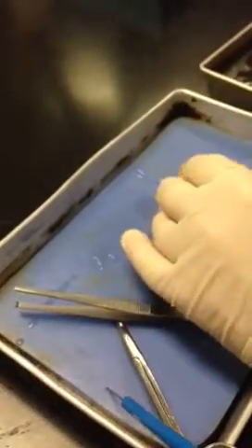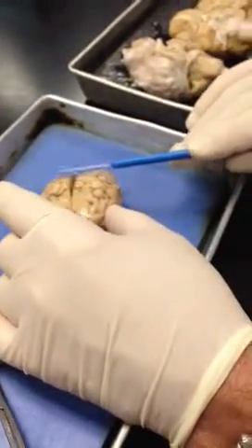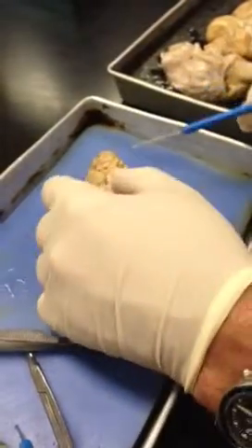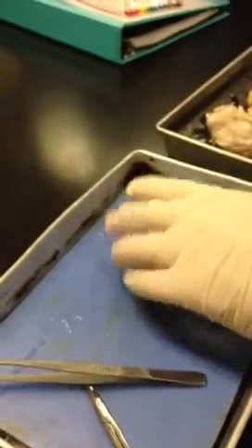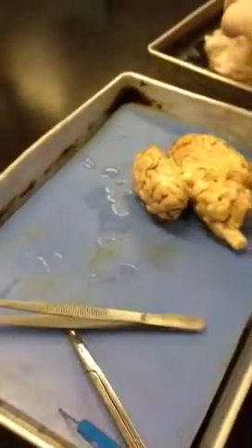I don't know if this works too well in a sheep brain, but sort of the frontal lobe, sort of parietal lobe, occipital lobe, temporal lobe, I guess, over here on the side. But I don't think I'd ever asked that question on a sheep brain. Anyway, so that's the whole brain. So I just kind of get the overview of everything on the whole brain.